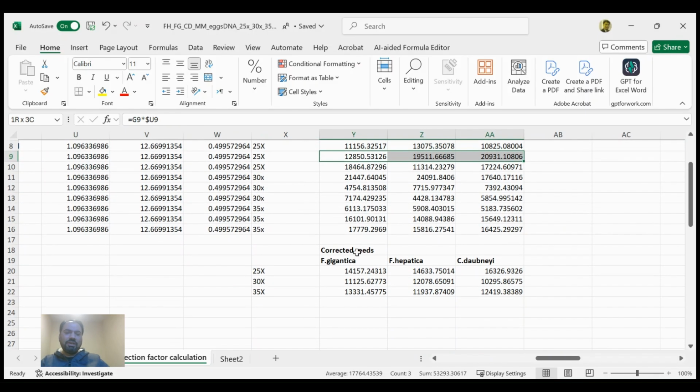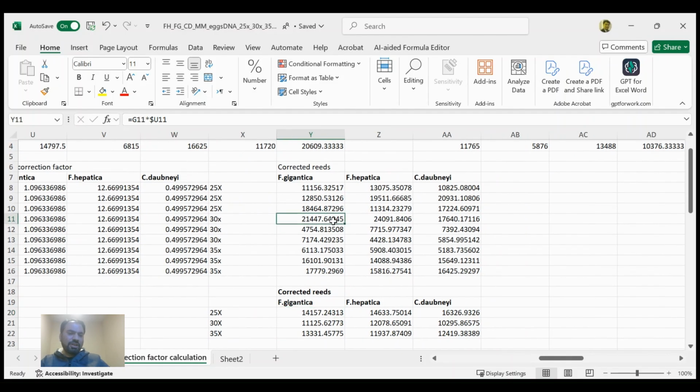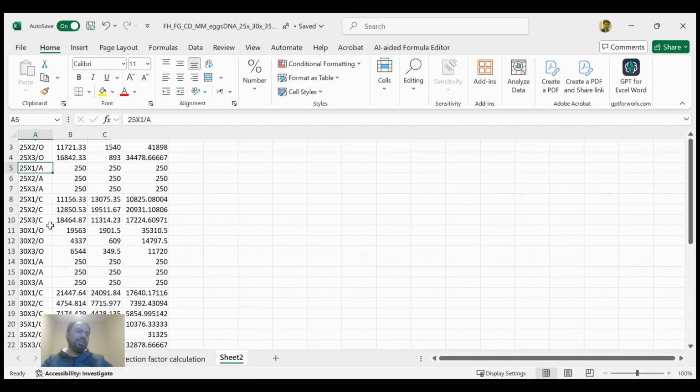And similarly, we have generated bias free reads after multiplying the correction factor with the average reads. So after getting this corrected data from the samples, we just paste it over a new sheet. Here in the first column, you can see the number of cycles, and further you can see that O is representing the observed reads, A is representing the actual reads, and C is representing the corrected reads.